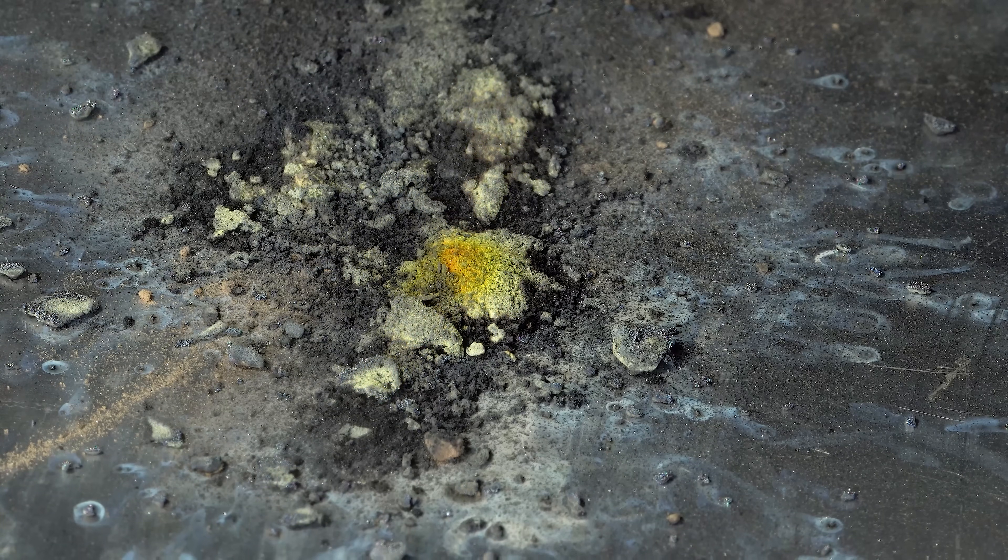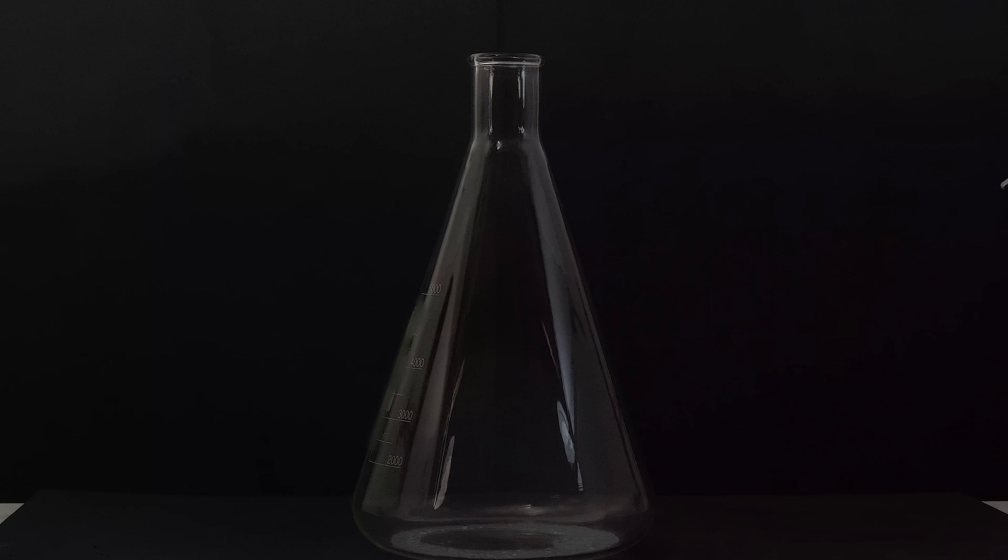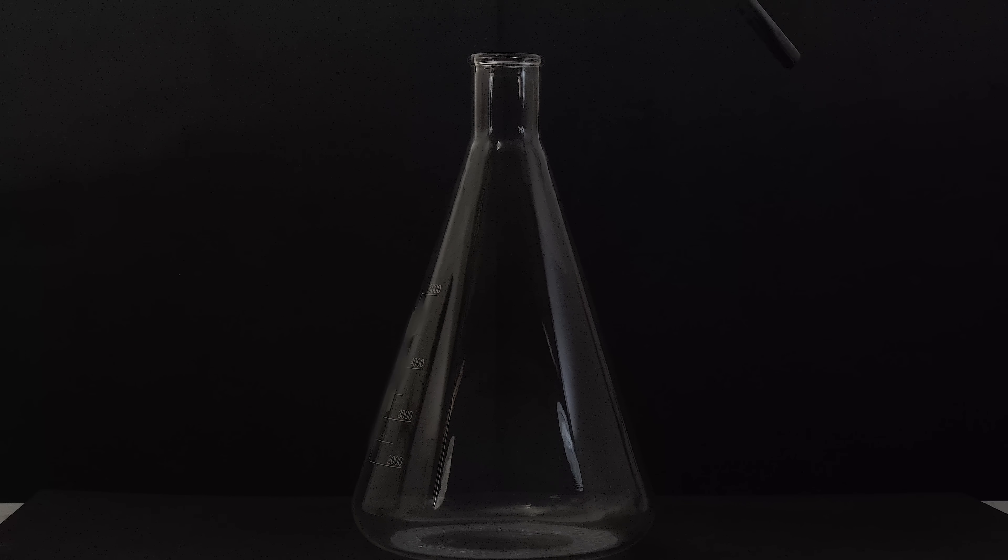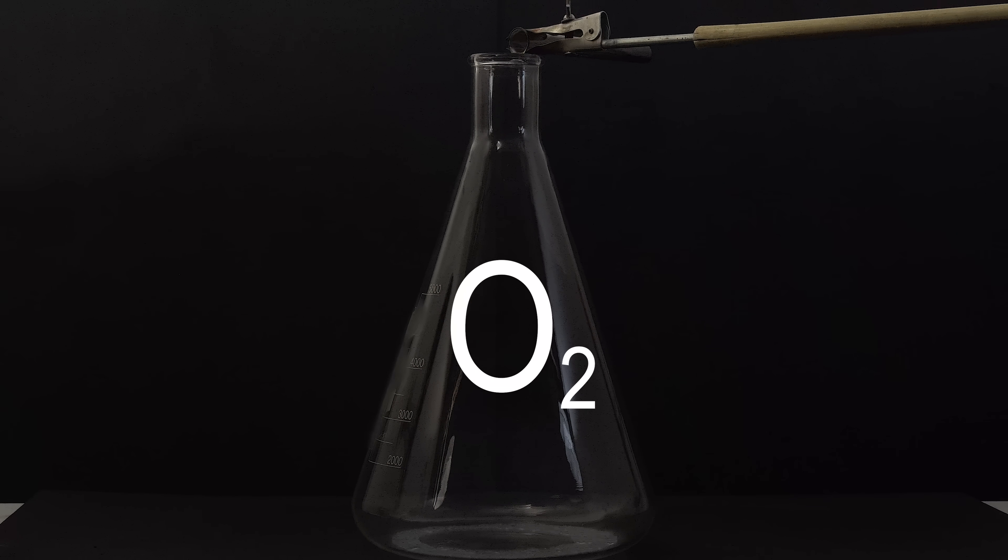Before this we saw how lead oxidizes in air, but now let's see what happens if I pour this powder into a flask filled with pure oxygen.